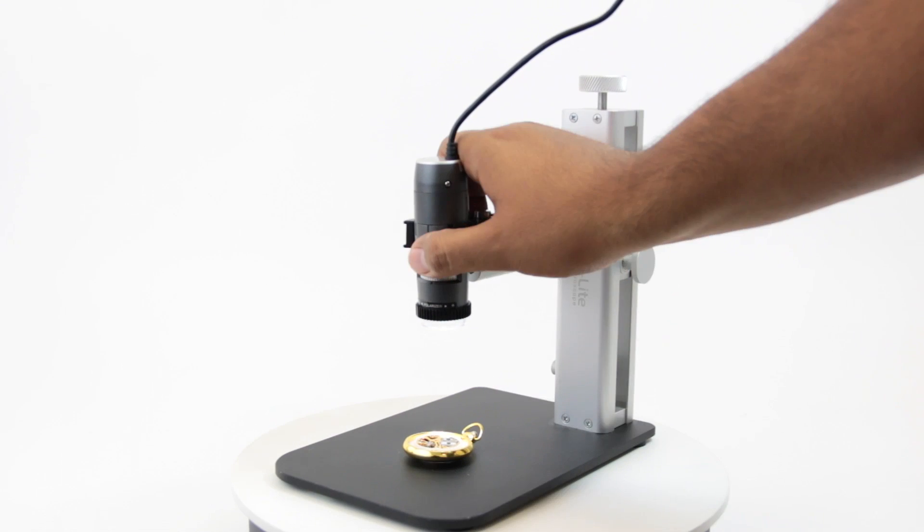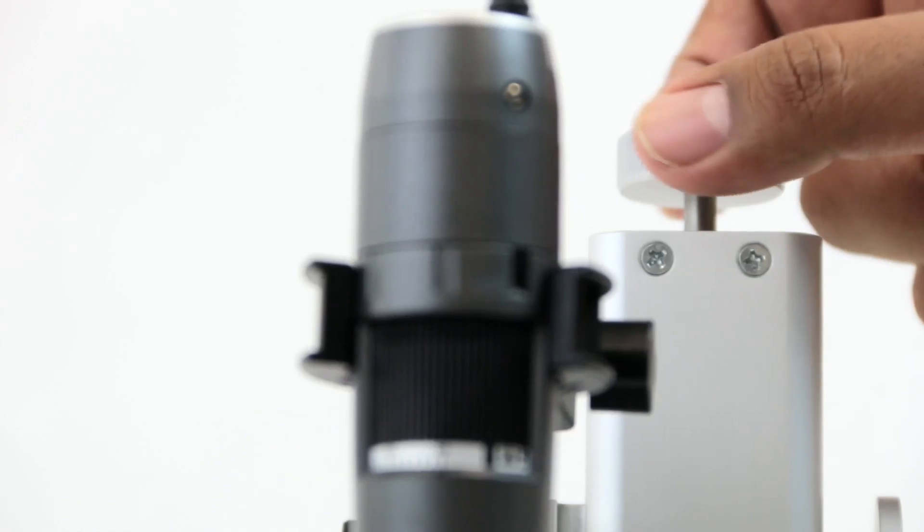While using a stand with a fine adjustment knob, slowly adjusting the knob helps to find focus.